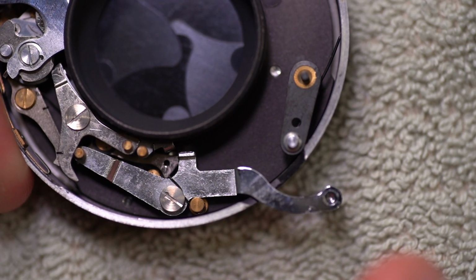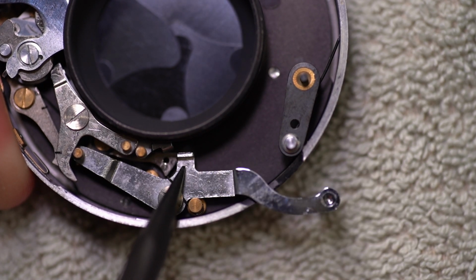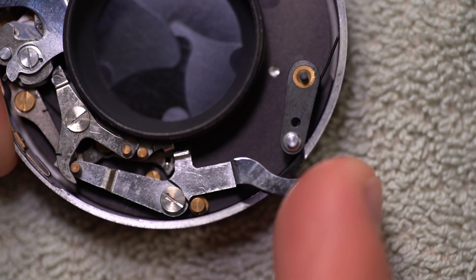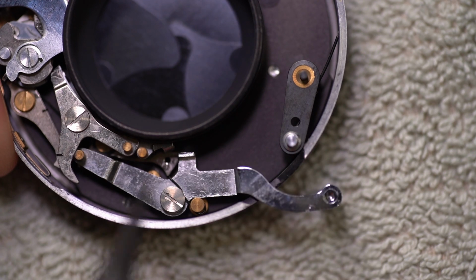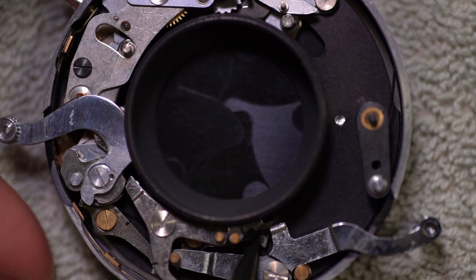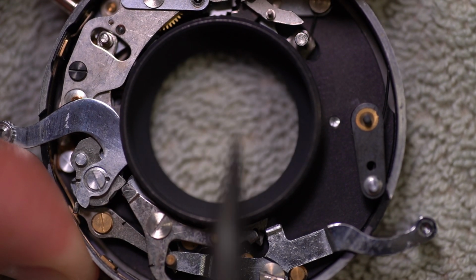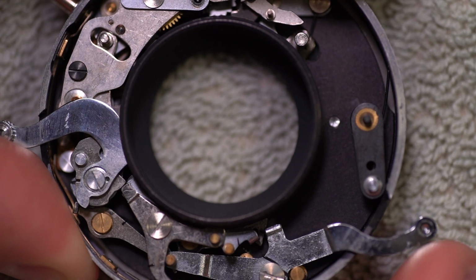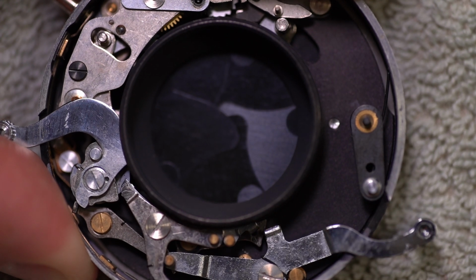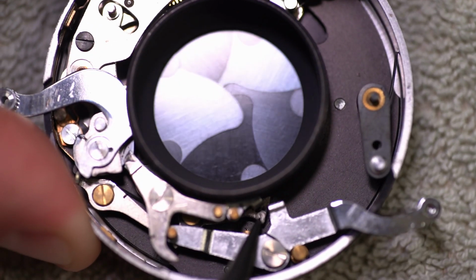What that's supposed to do is come in here, and there's a pin on the bottom of this, and it's supposed to have just enough force that when you push that in, it pushes this part. I'm going to get this over here so maybe you can see this. Now watch the iris in here. I'm going to push this little piece in, that opens up. If I push this lever again, it closes back down, because that second time, it's no longer needing to contact this little piece here.